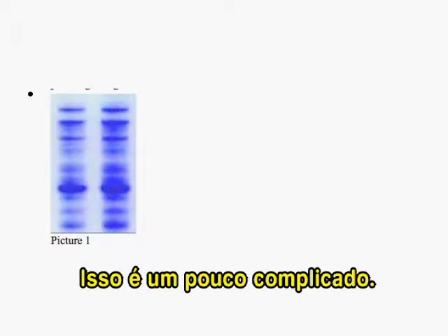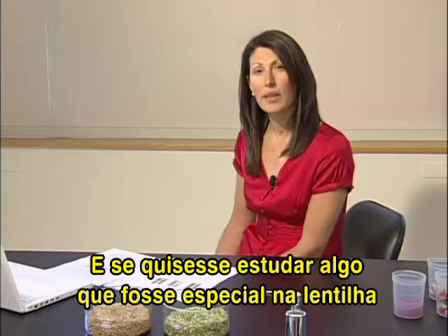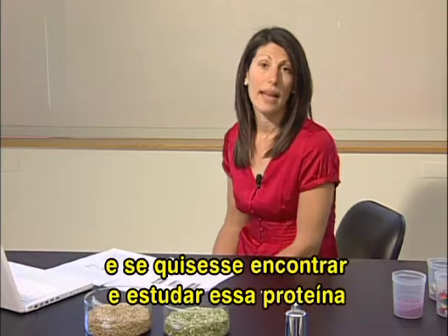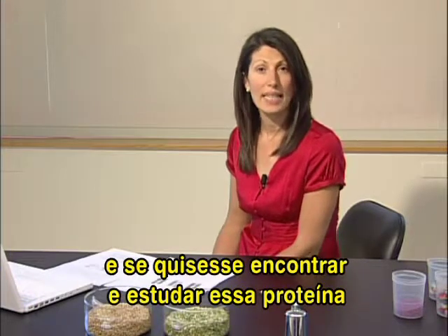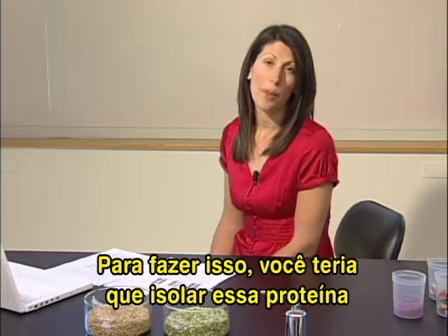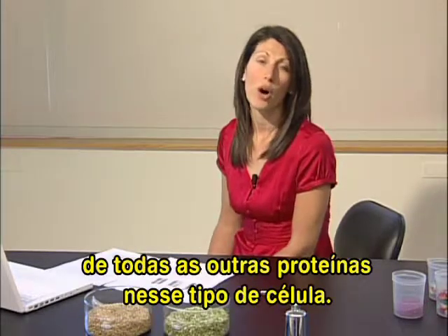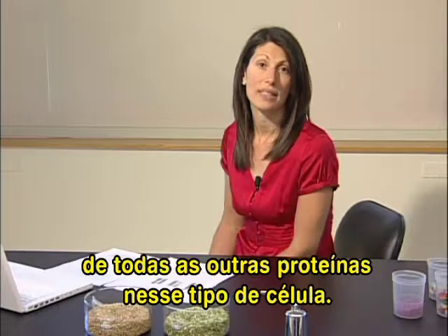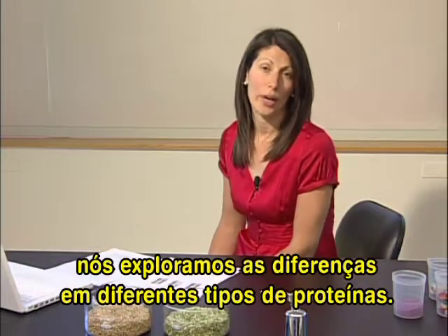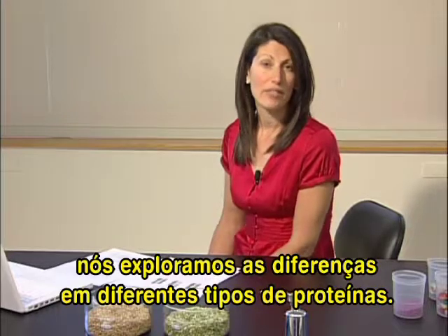So this is a little tricky then. What if you wanted to study something that was specialized to, say, the lentils and not in the green peas? And you wanted to find a protein and study that protein just from lentils. Well, to do that, you would have to tweeze apart that specialized protein from all the general housekeeping proteins in that cell type. And the way we do that in the laboratory is to exploit some of the differences in different kinds of proteins.